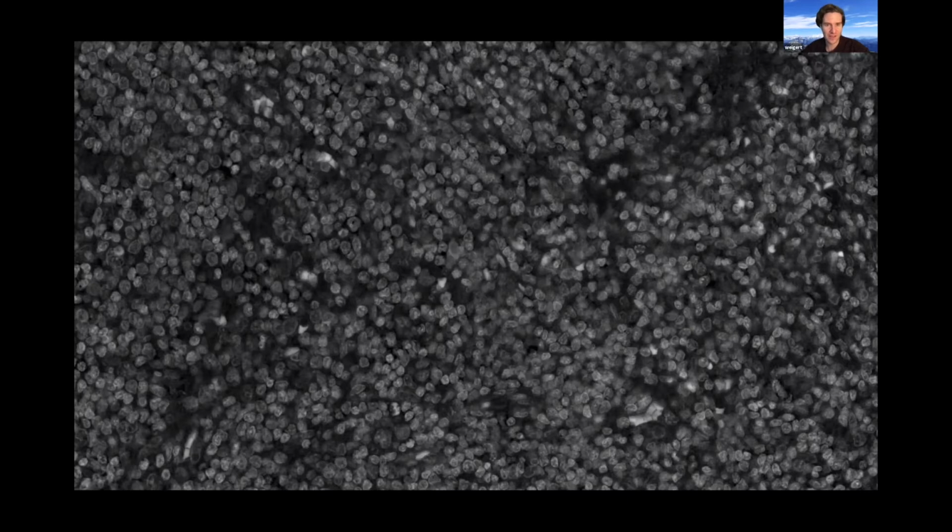Even yourself, if you would do it once again for the same image, probably the result of your annotations would be different each time. And a deep learning based pipeline would just try to recapitulate that. Of course, it will give you always the same result, but this result is biased towards your annotation selection.